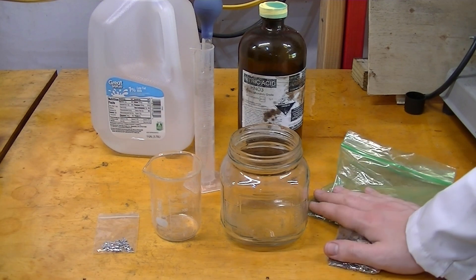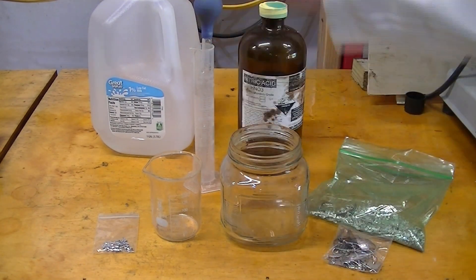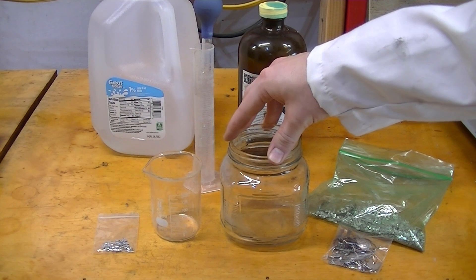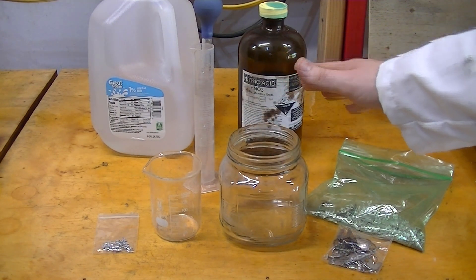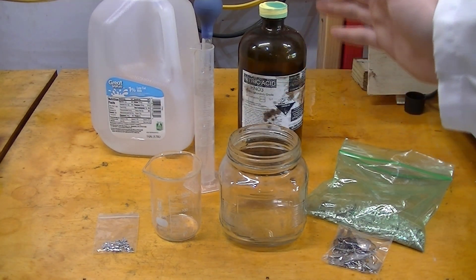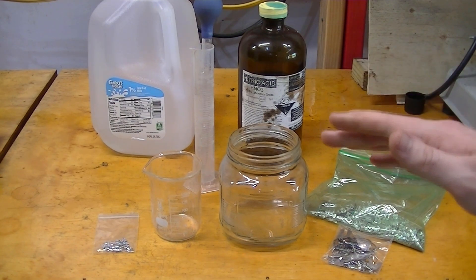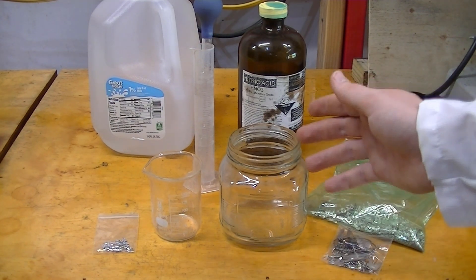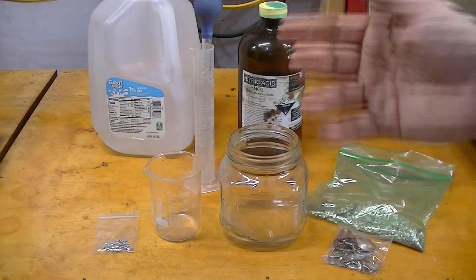So we're going to add this into here, add water, we're going to heat it up some, and then we're going to add the acid, which will dissolve everything. All right guys, let's get ready to go.